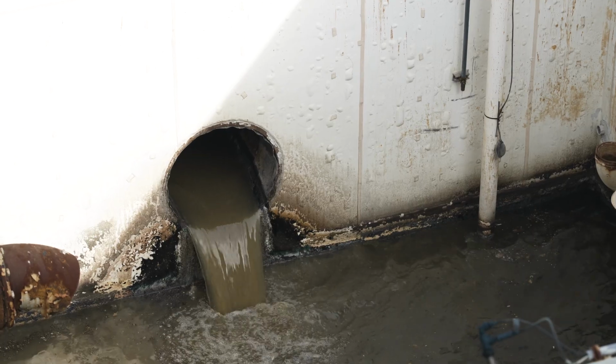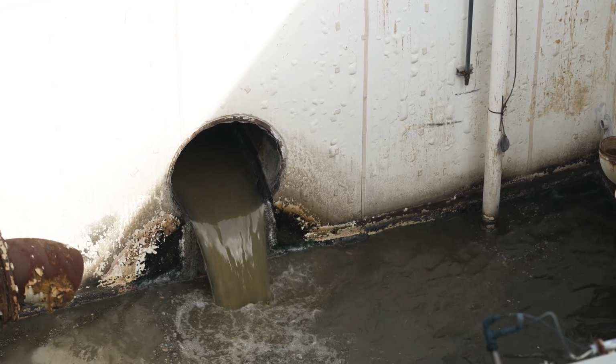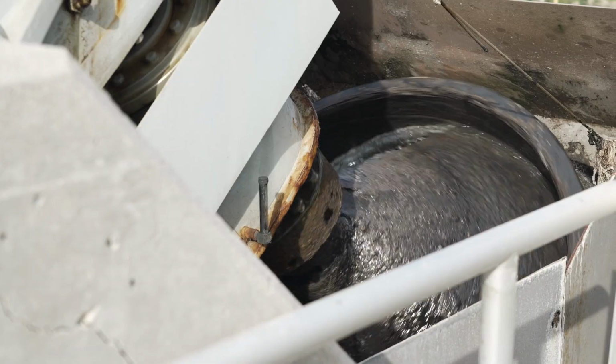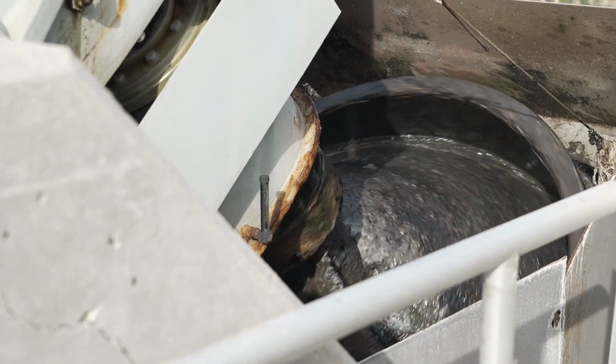So Eric, how and where do you all get the samples to test? Maybe you can run us through what samples you're taking and the analysis that is being done. Sure. Most of our samples are taken at different points here in the reclamation plant, starting with headworks where the untreated wastewater enters the plant. We have a pump that we can fill up sample containers with, and this lets us get a sort of starting baseline for the treatment plant so we can determine how well it's removing everything that needs to be treated.